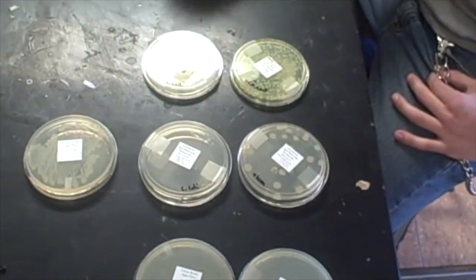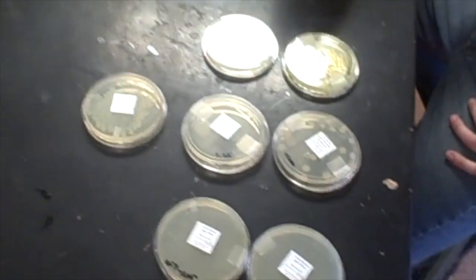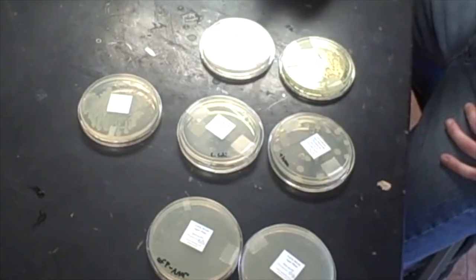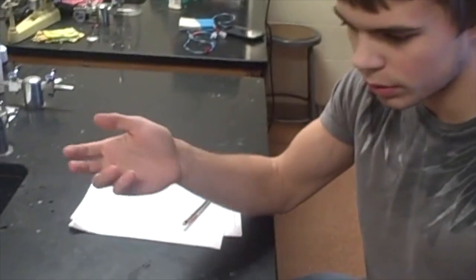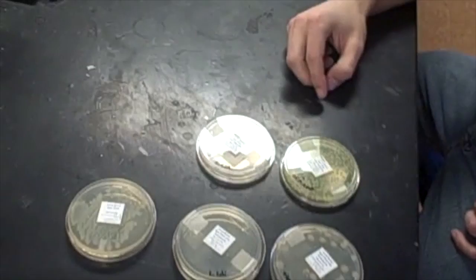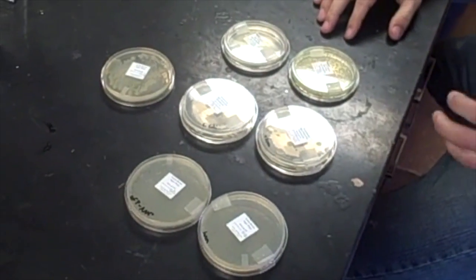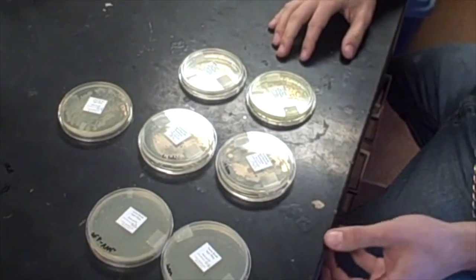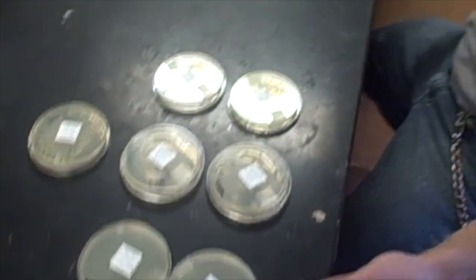So we put the bacteria in the vials, we chilled them, we heated them, and we chilled them again. And this sequence helps to transfer the plasmid into the bacteria. Then we added broth, which is their food, and we mixed it. We spread this bacteria broth onto each of these 6 plates, and we put beads on them, rolled it around to cover the plate with the bacteria.